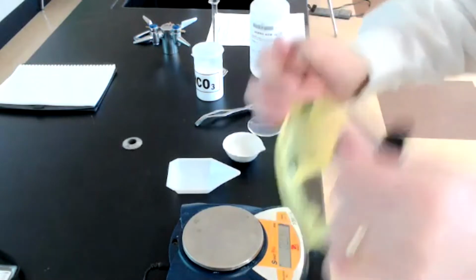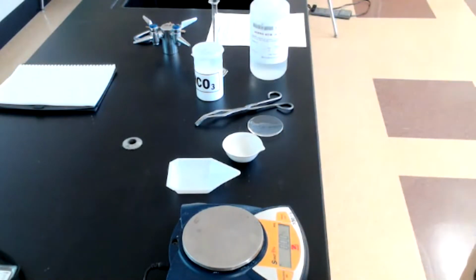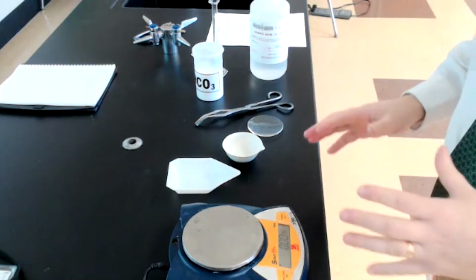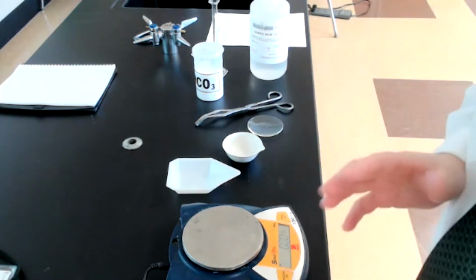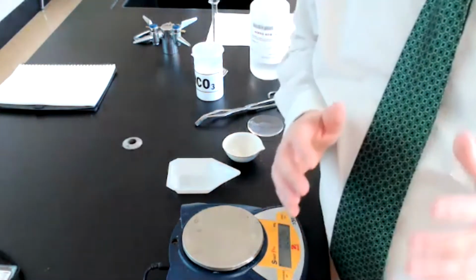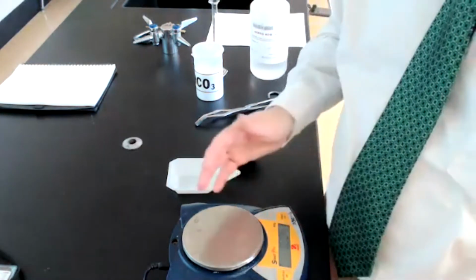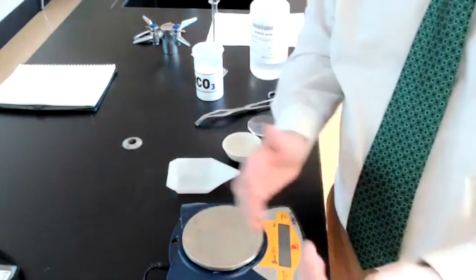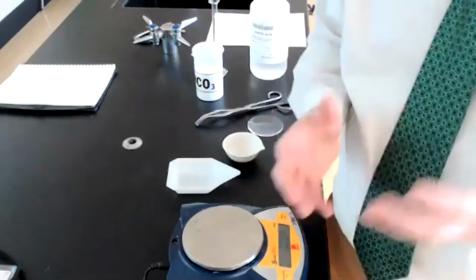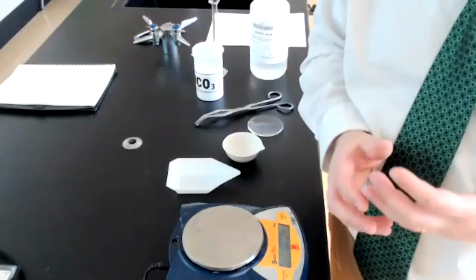Okay, I'm going to begin by putting on my goggles to protect my eyes here. We are using heat. We're using some glassware, so we want to make sure that we protect ourselves. And the other thing that we're going to do is always make sure that we're wearing closed-toed shoes. That way, in case anything were to spill off of the lab bench, or if we were to drop anything on the floor, our feet are going to be protected.